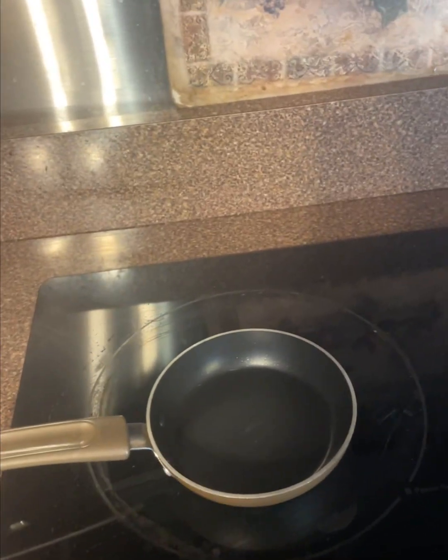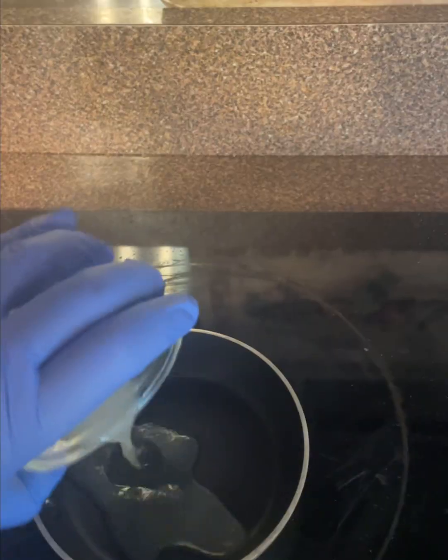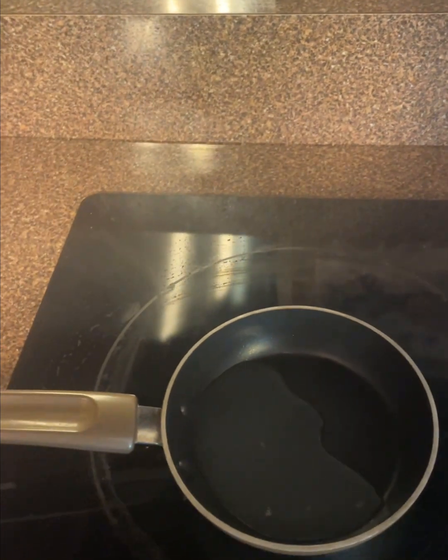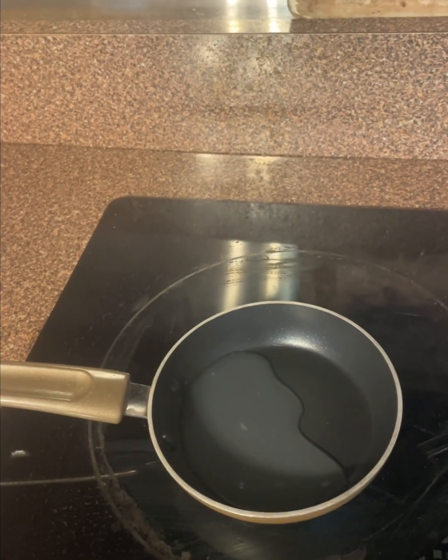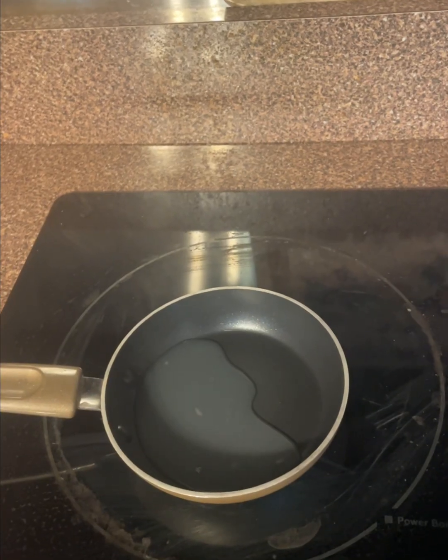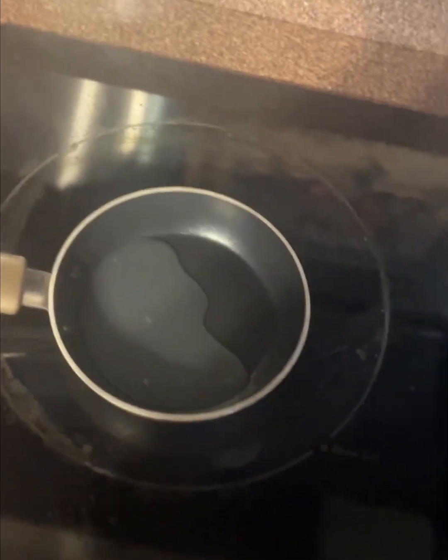For my physical control method, I selected moist heat boiling for the sauerkraut brine. I have measured about 15 milliliters of my 21-day brine and I'm adding it to a small saucepan. I'm going to bring the brine to a rolling boil, and once it's reached the rolling boil, I'm going to allow it to boil for about 1 minute. Then I'll remove it from heat and allow it to cool completely to room temperature before plating. Turning on the stove.